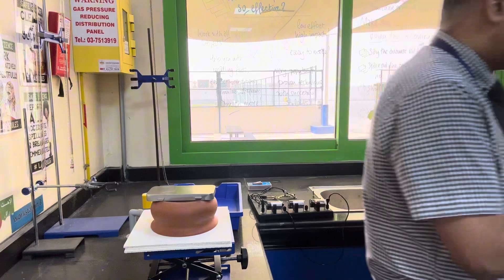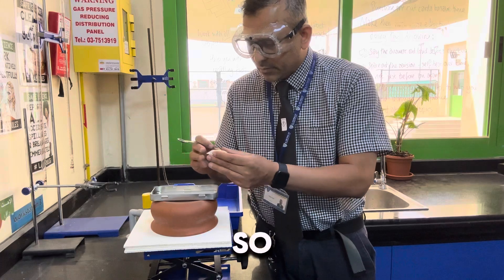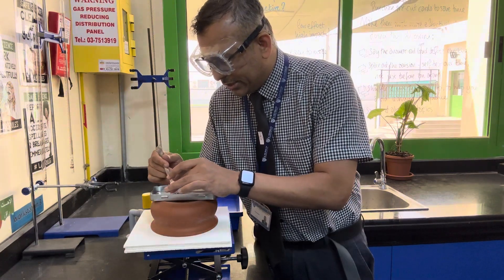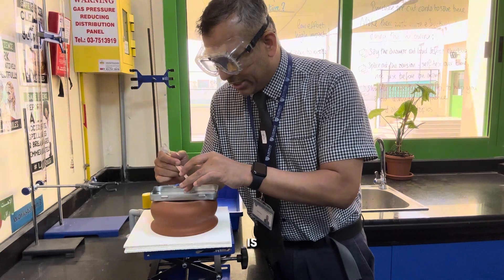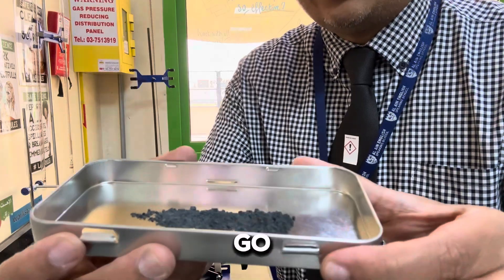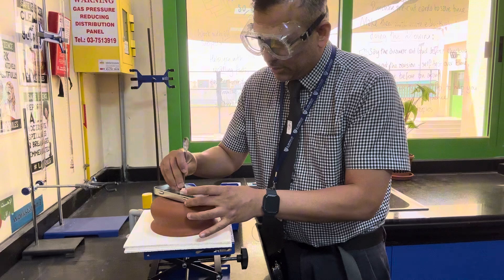I've mixed it up. I now have a tin lid. I'm going to pour it, but in a specific shape — in the form of a sujuk sausage. Right, here we go. Now what I am going to do is heat it up. I'm just going to make it a little more sausage shape.